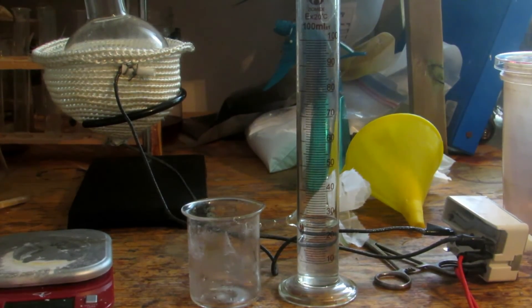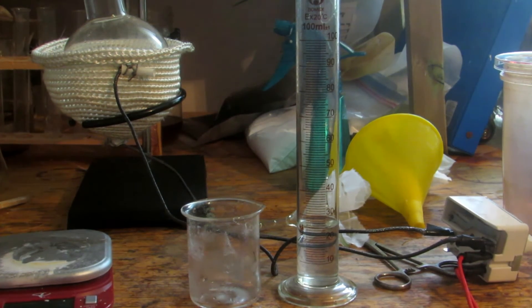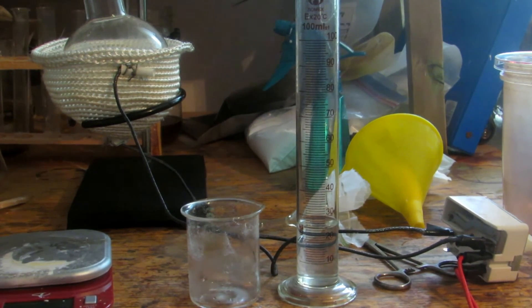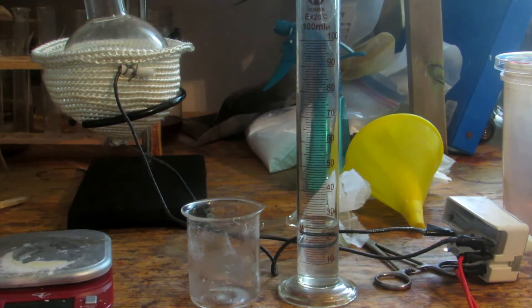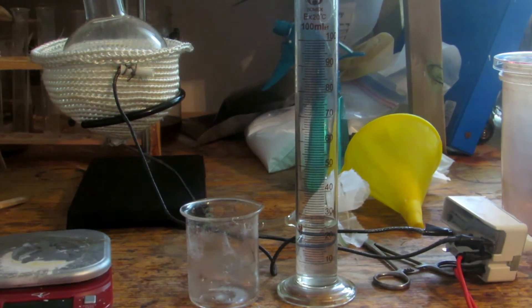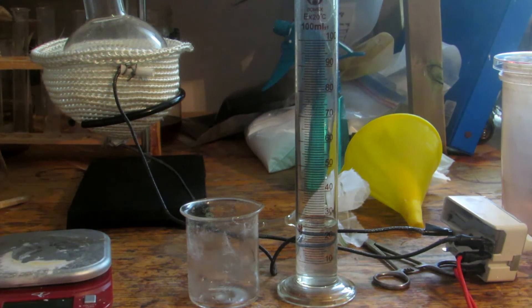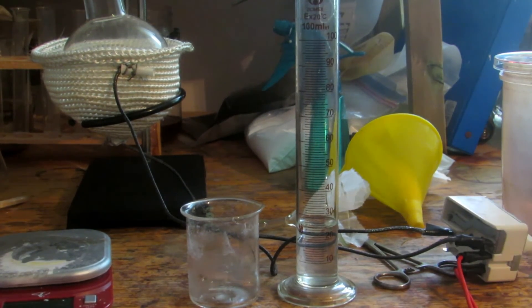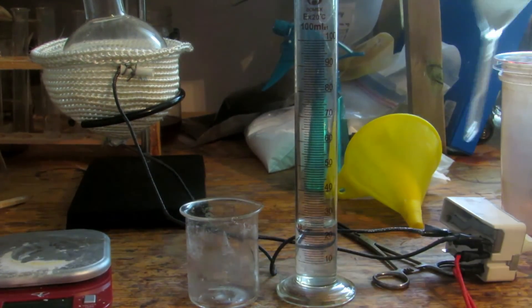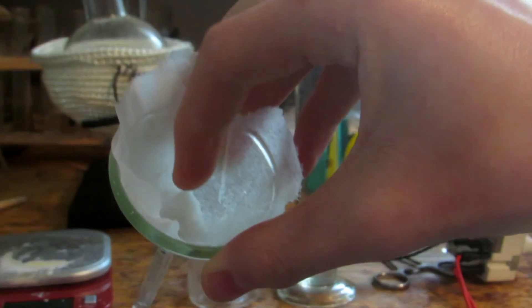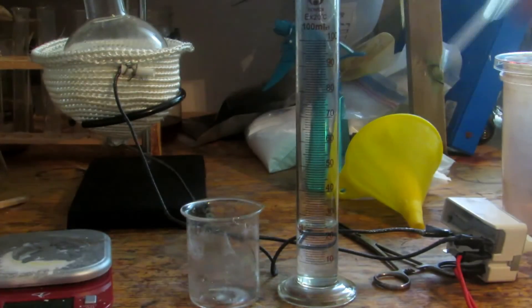When I first tried to crystallize the potassium iodate by cooling to 0 degrees Celsius in 100 milliliters, it was still totally soluble. Because 4 grams of potassium iodate is soluble at 0 degrees in 100 milliliters of water, and we didn't have 4 grams. So I boiled it down to about 25 milliliters, then filtered it off, and we were left with some nice potassium iodate in this filter paper.